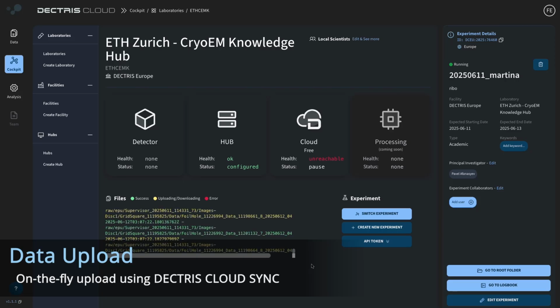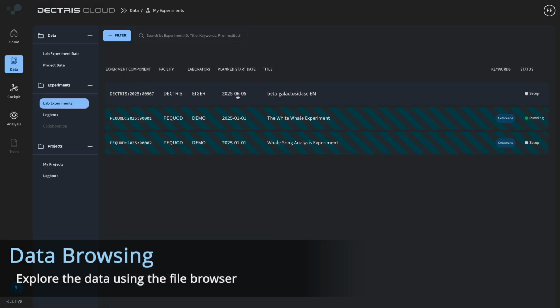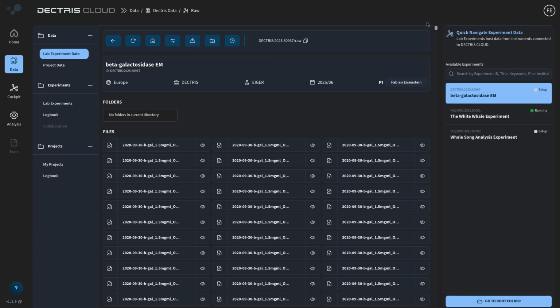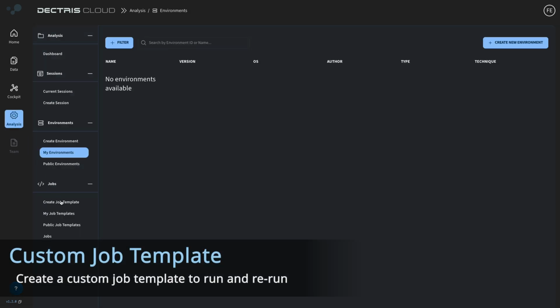You can either upload the data directly from the microscope with the DECTRIS Cloud Sync, or in my case, I already have uploaded them after acquisition in the data folder, and here we can see the experiment. The raw folder contains all my TIFF frames, and unfortunately I did not save the gain reference.